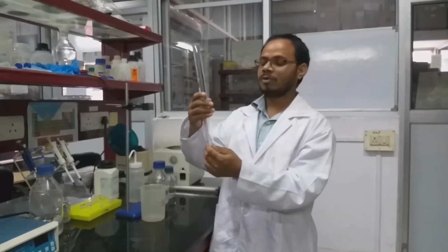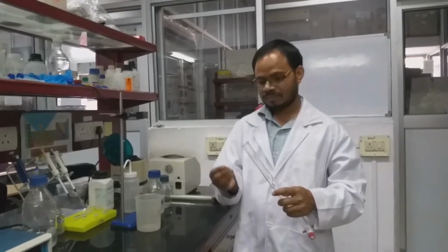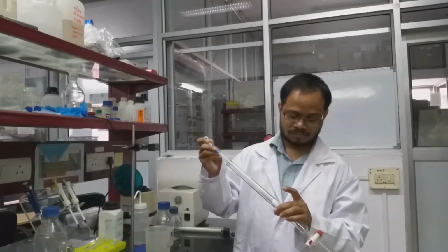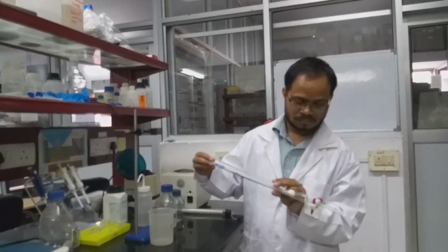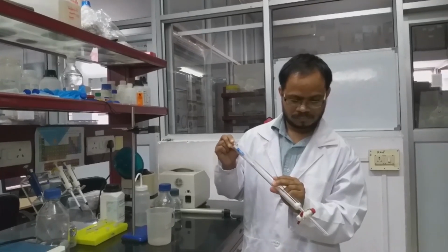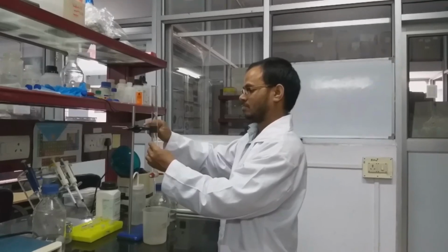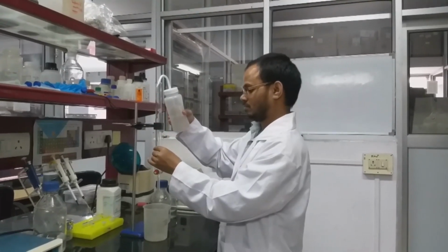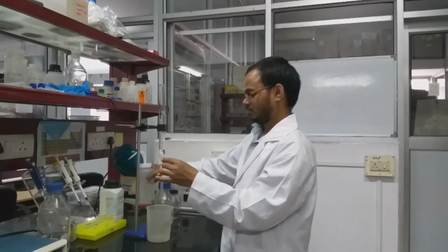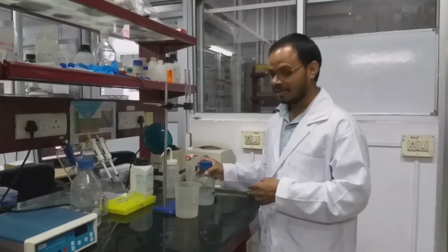Here we don't have an exact sintered filter, but we can use a piece of cotton. Just put the cotton. So now we have inserted the cotton. These are the beads we are going to use for packing of the column. These are Sephadex G75 beads.